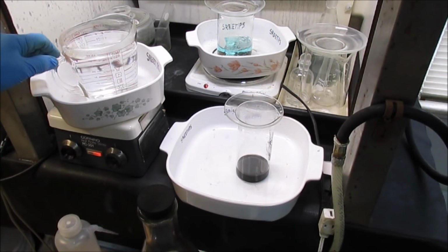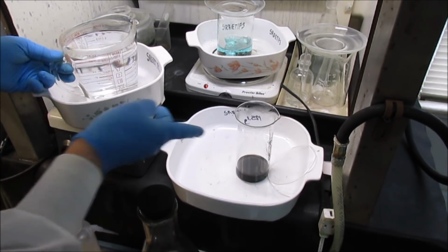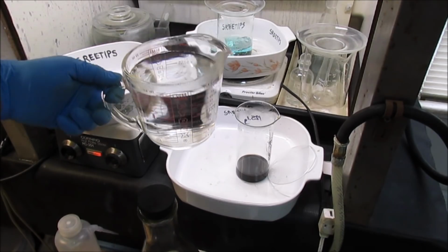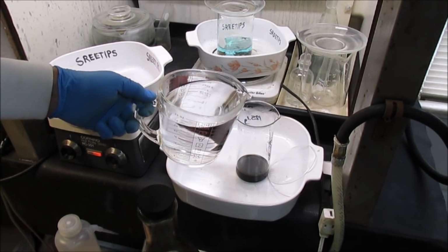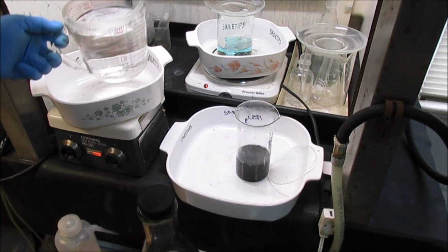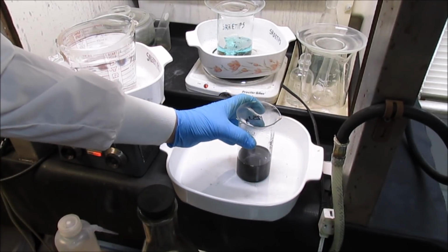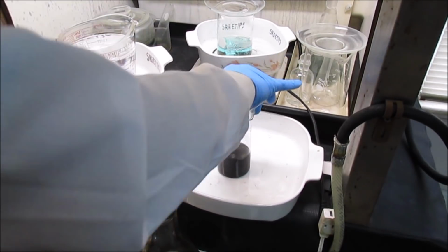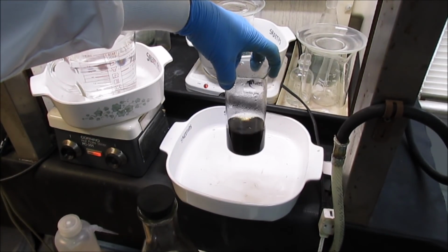I've got some hot distilled water here. I'm going to add a little bit, do some small rinses here. Hopefully, if the black powders down here are in the state that I want, this will settle out right quick after I put this water in. I'll just keep rinsing it until I get all the waste solution rinsed out of it. Look how fast that settles. That's what I want to see.